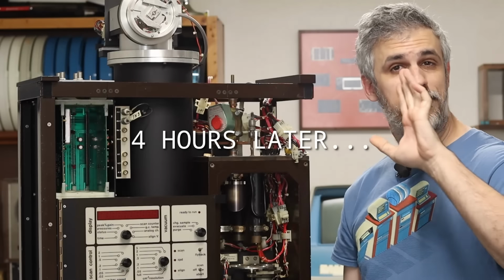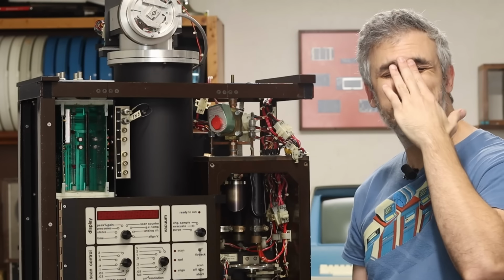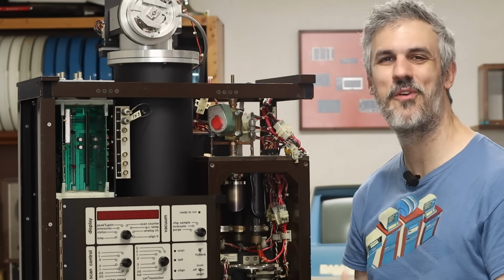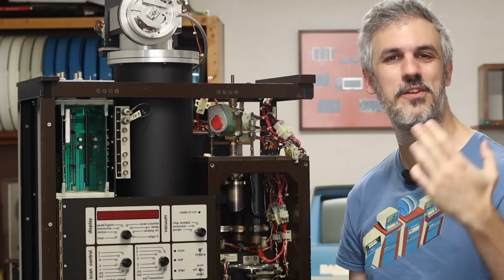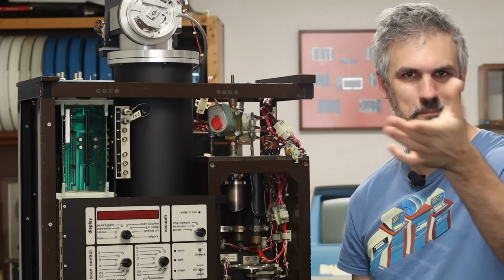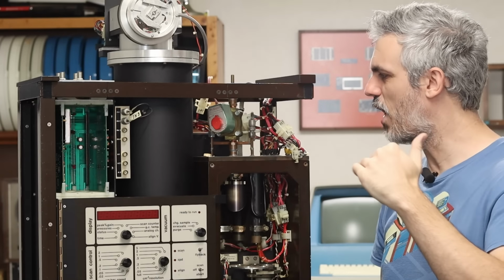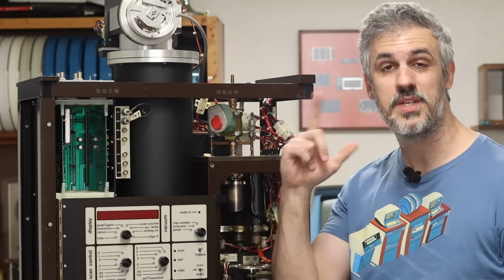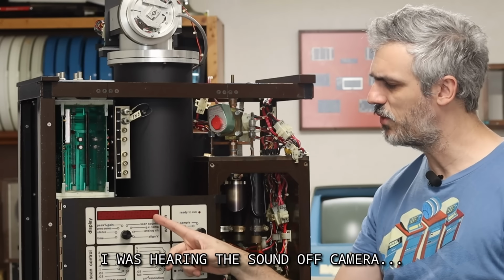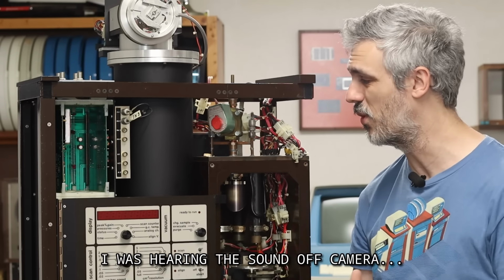All right, it's been like 4 hours since I last saw you guys. Things have gotten interesting. We're running into a lack of knowledge on my part here. But I think where we left off, just like 20 seconds ago for you guys, was we had fired it up and I was hearing a sound that I hadn't really heard before, and we're seeing an alignment voltage here that I hadn't really seen before either.